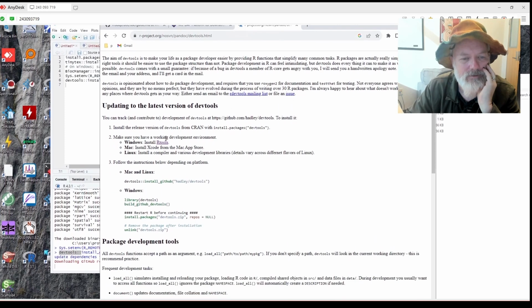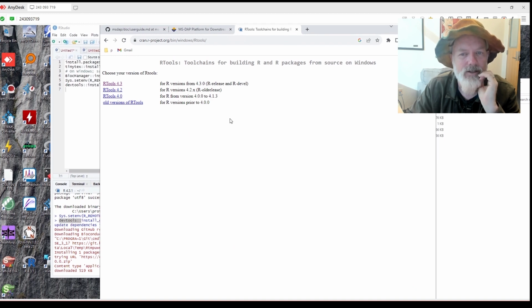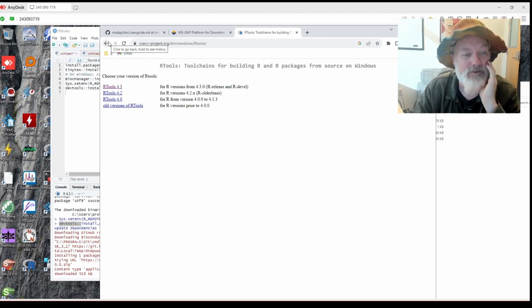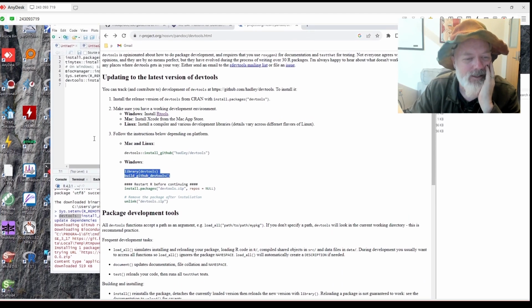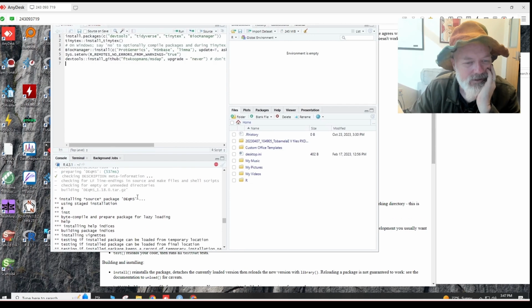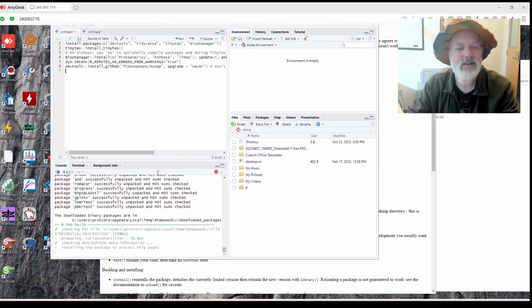Let's see. On Windows, install RTools first. So you have to install RTools. I don't believe this is installed by default when you put in R in RStudio. So you go to RTools, download. The current version is 4.3. This is October 2023. Might be a different version when you do it. And then you have to, on Windows, do this, and it's kind of a pain. Sometimes it gives me an error, sometimes it doesn't. Let's see if this is giving me an error. Successfully installed. It does a bunch of stuff. Bioconductor. Okay, let's see if it's working. It's still working. Okay. All right, let's see if that works.